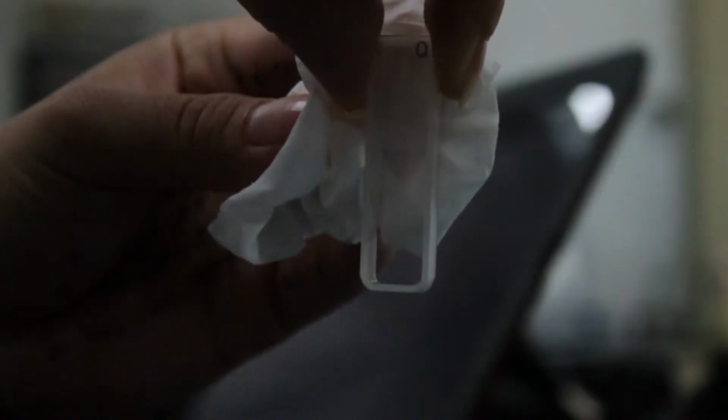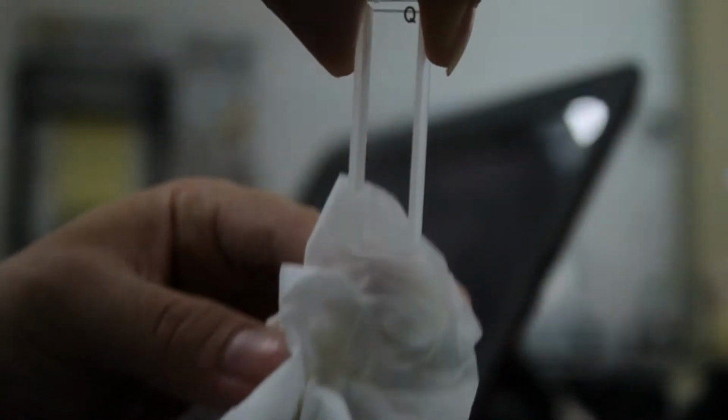Secondly, we need to ensure that both top and bottom measurement surfaces are clean prior to loading blanks or samples, as it is important to avoid problems with subsequent readings. Performing a blank measurement on a dirty sampling surface will result in erroneous absorbance values, such as negative spectra or sample concentration being calculated as lower than the actual values.